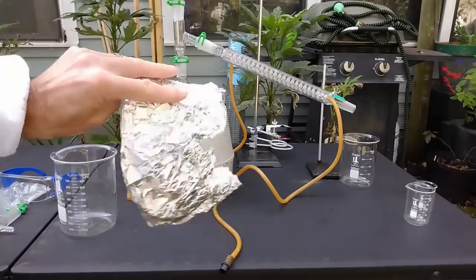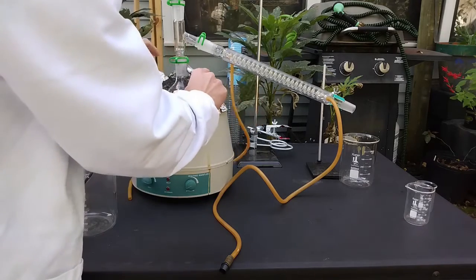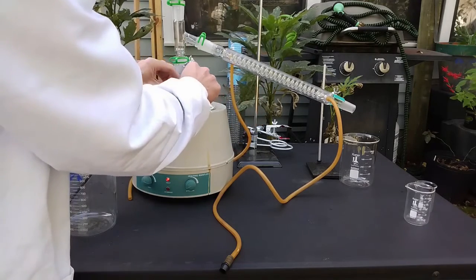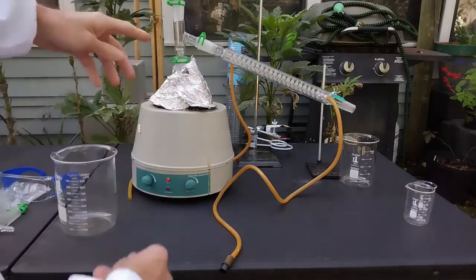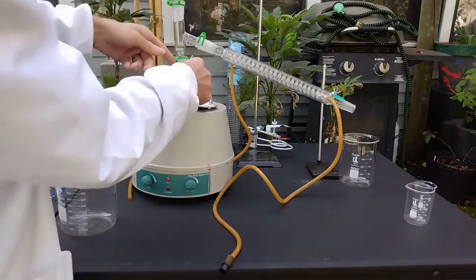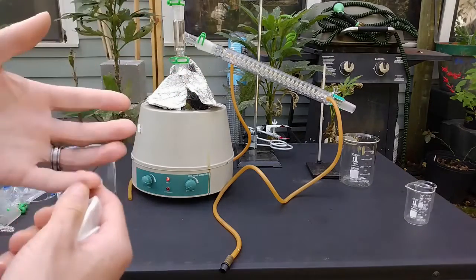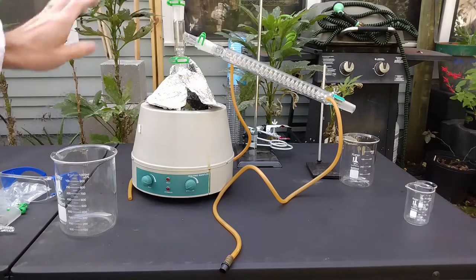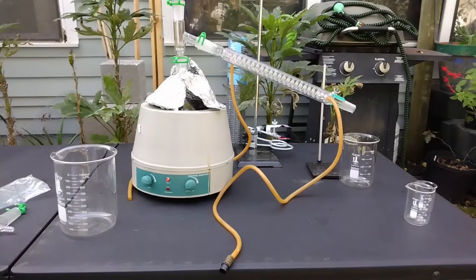It's also useful to put some aluminum foil around the flask — that will help it reach the boiling temperature. We have to be careful, because when we want to check if it's boiling and open the setup, cold air will hit the flask and the sudden temperature difference could shatter the glass. So we have to look very carefully and definitely wear eye protection.